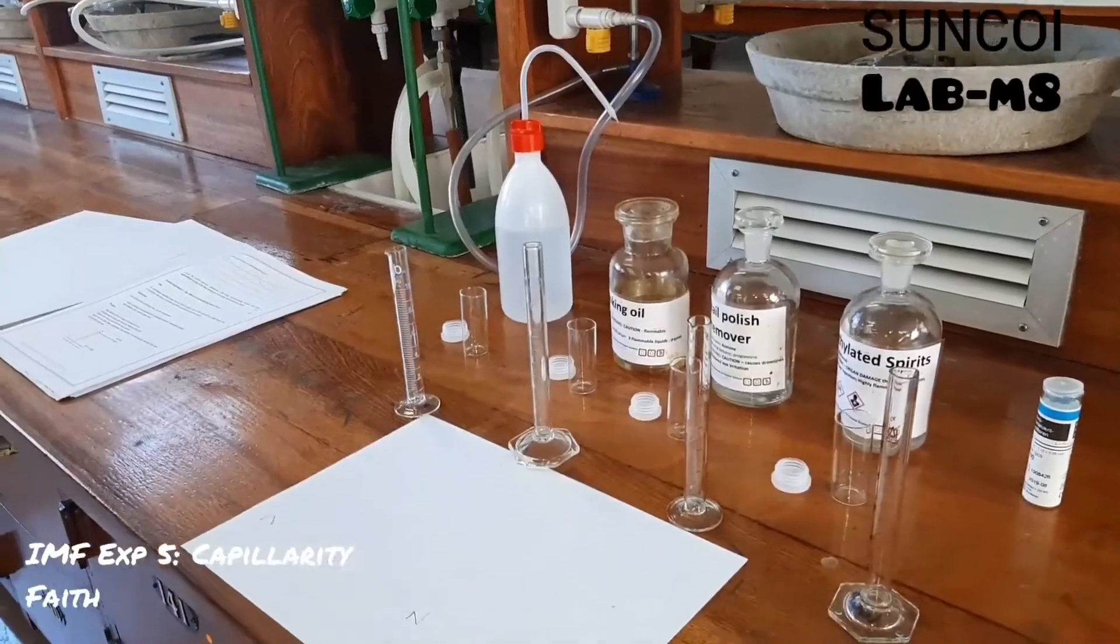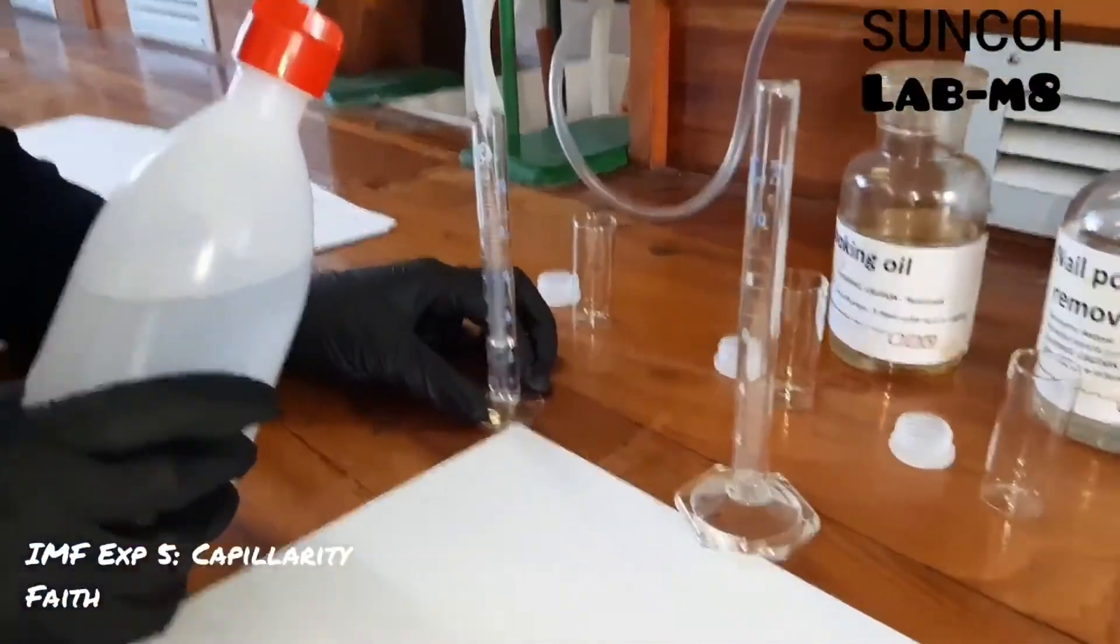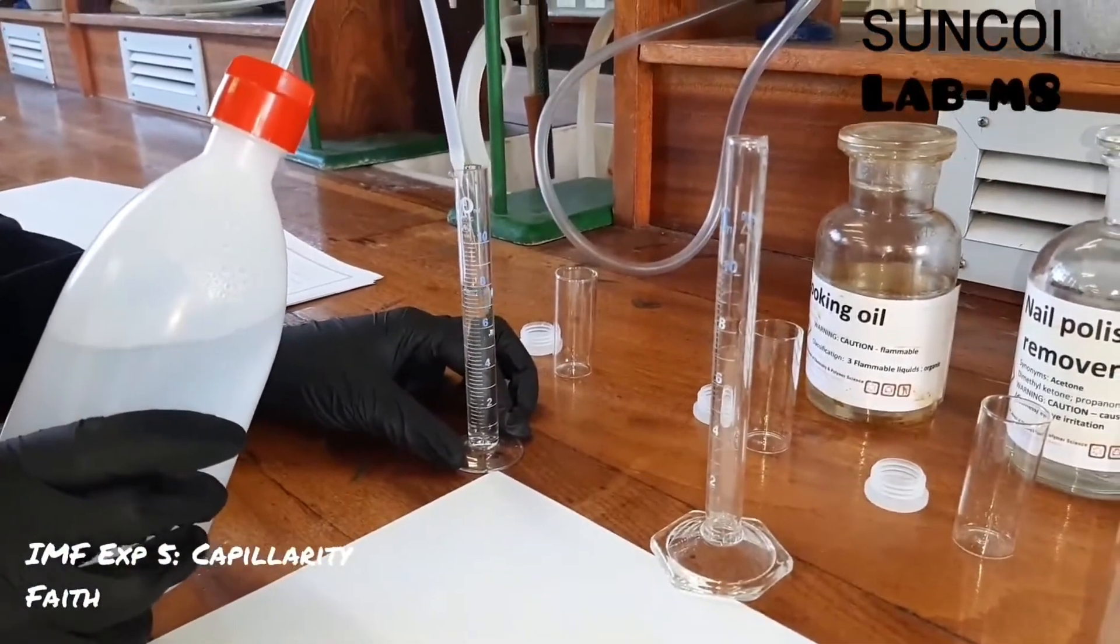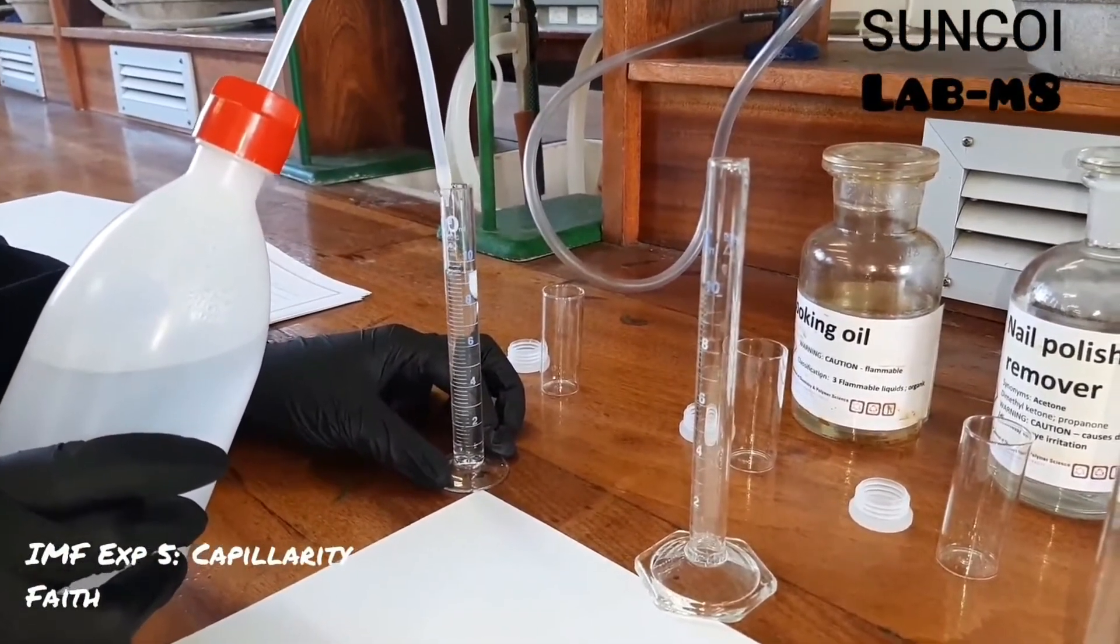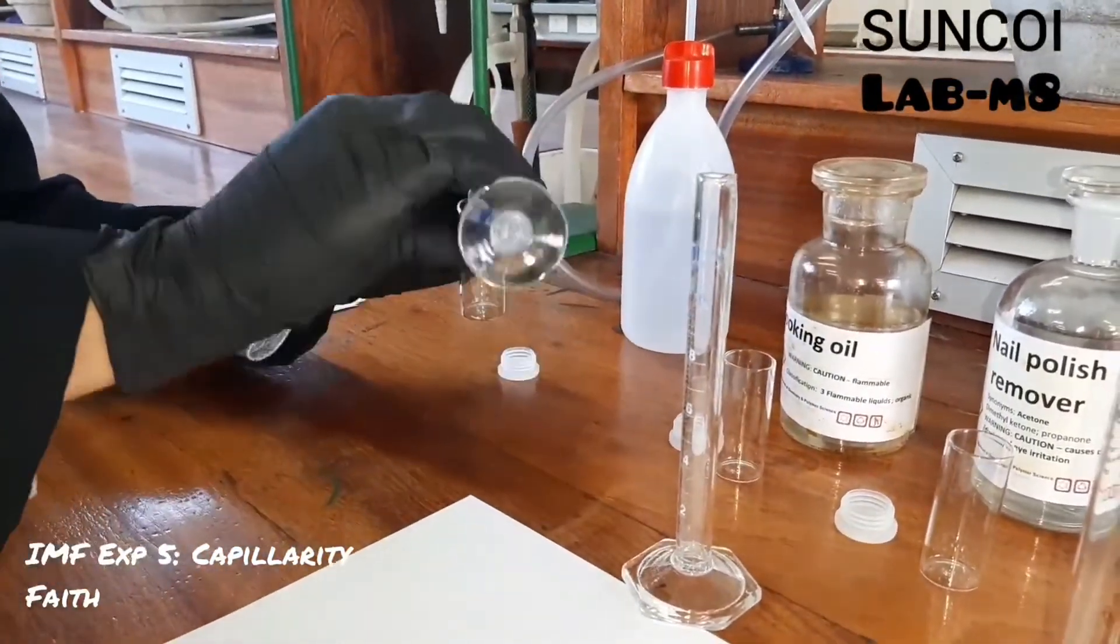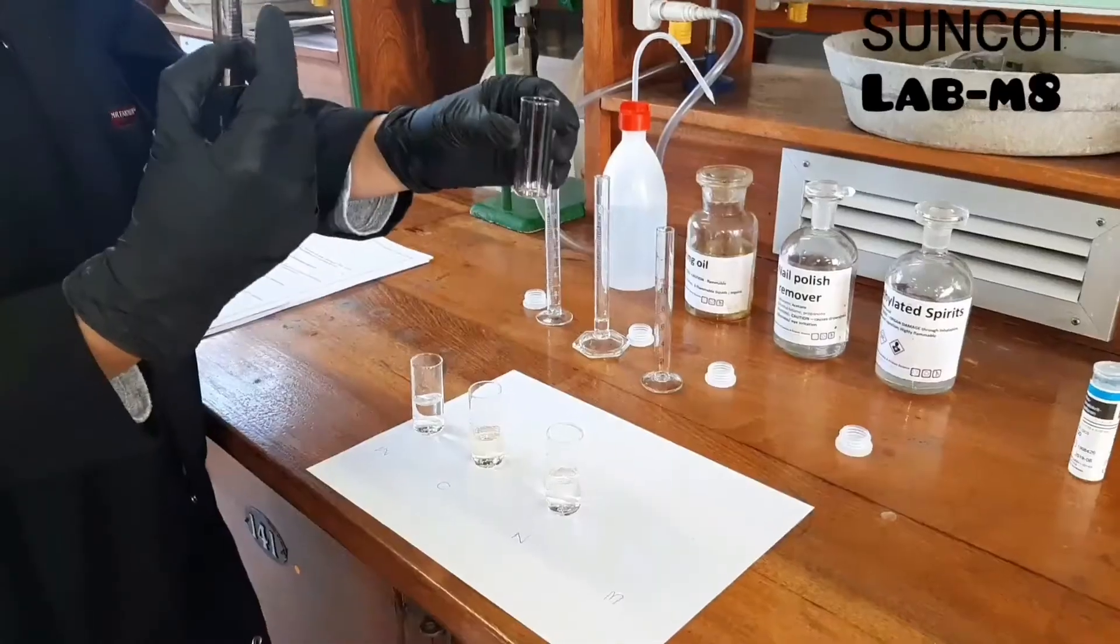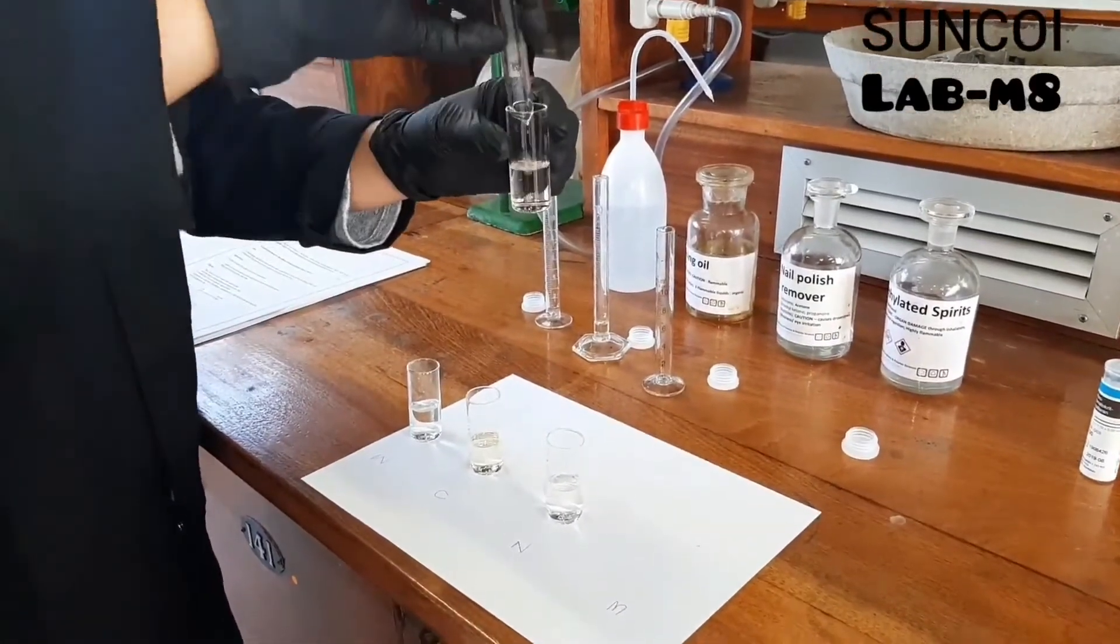The purpose of this experiment is to check the capillary action of four different solvents. Faith is measuring out 10 ml of water and then cooking oil, nail polish remover, and 10 ml of methylated spirits as well.